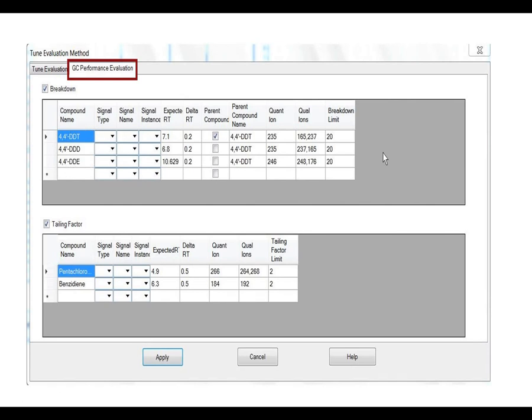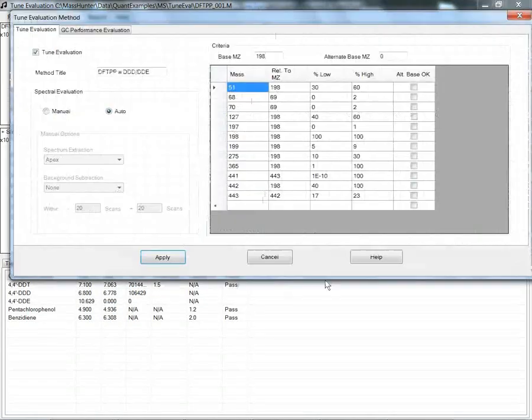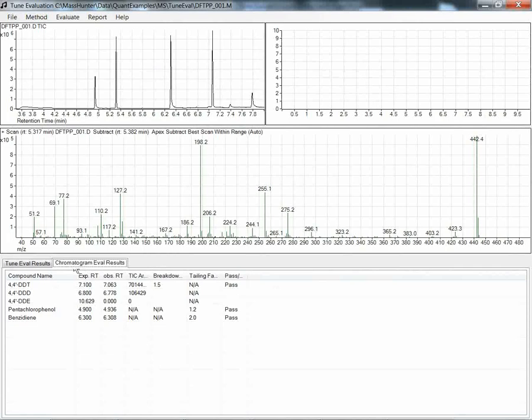In a similar manner, I'm able to evaluate the tailing factor for pentachlorophenol and benzidine. And if I look here, I define those signal types in terms of the ions that I'm looking for and the tailing factor limit that I consider to be acceptable. So the demo, basically looking at the GC performance evaluation criteria that I have just gone over, applying those, and you can see that on the chromatogram evaluation results, I've got a pass for the DDT breakdown, and pentachlorophenol and benzidine are within the limits of the tailing factor as calculated.